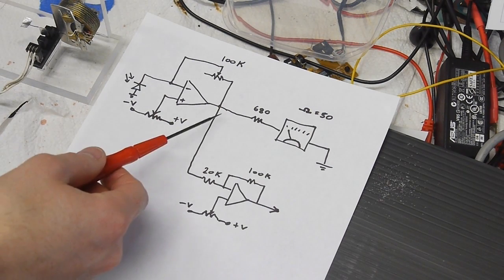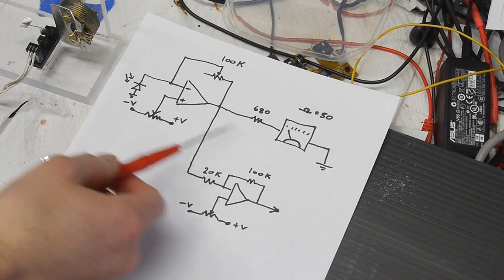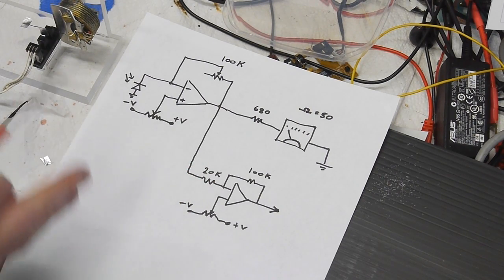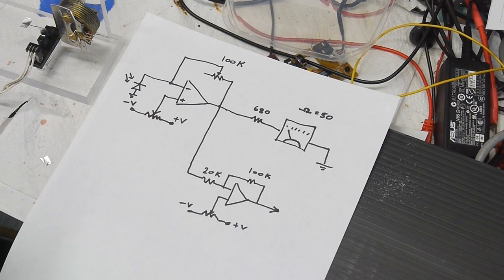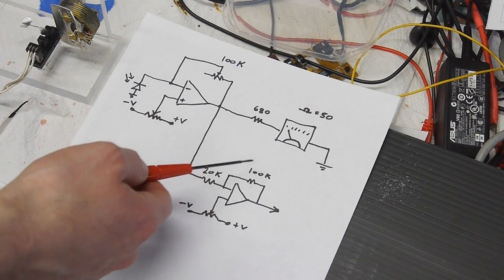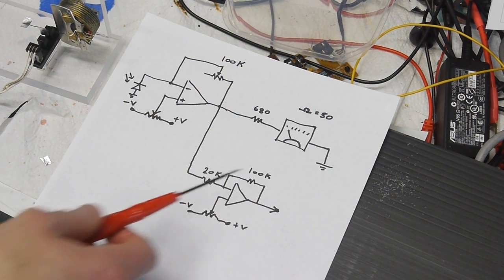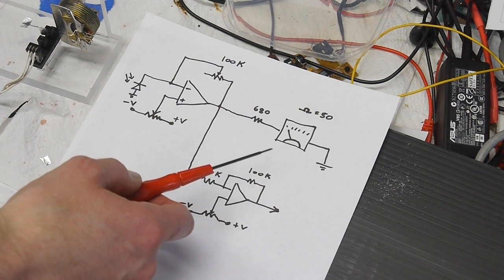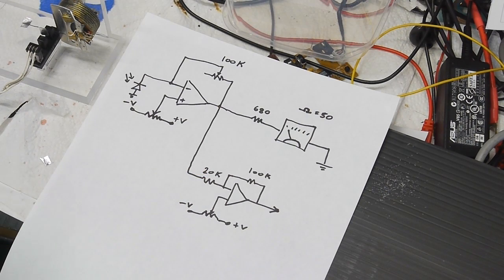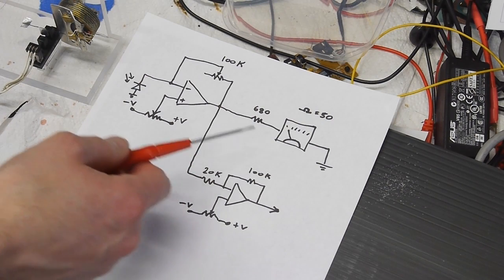The idea is that the voltage at this node is going to change based on how we load the meter. So if this thing's constantly trying to servo to the same exact physical point in space, if we put some mass on the tip of the needle, the meter needle, then this thing's going to have to give the meter more current to pull it back up into that spot. And since this thing is so sensitive, it's only 1 milliamp full scale. If the meter were mounted in a panel, then very, very small current changes here will change the position of the needle.